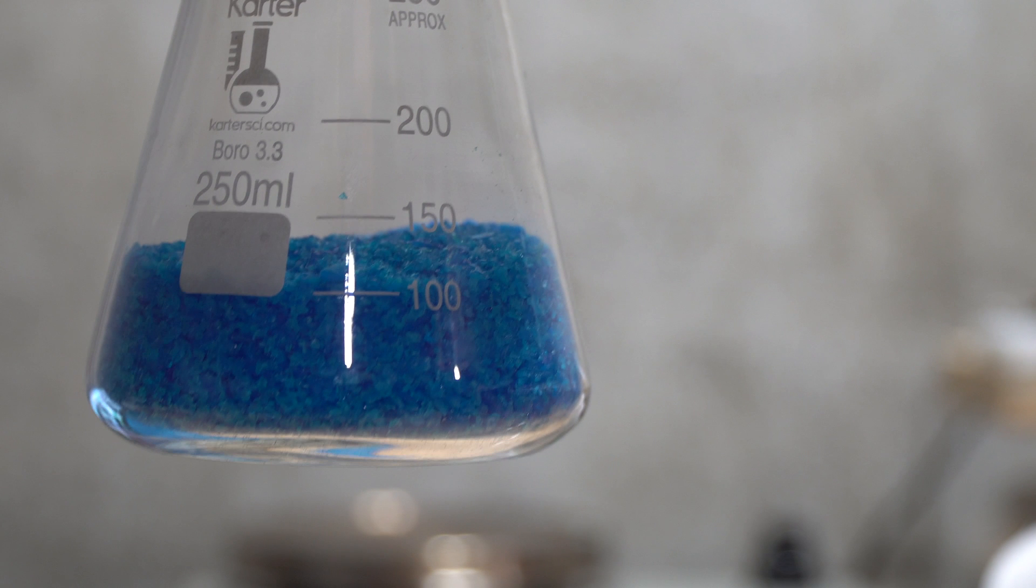Hey everyone, just wanted to put out a quick video showing you how to get copper metal out of store-bought weed killer.